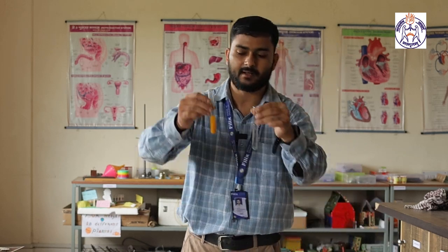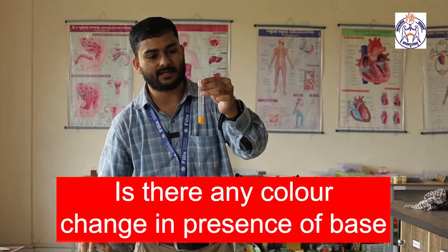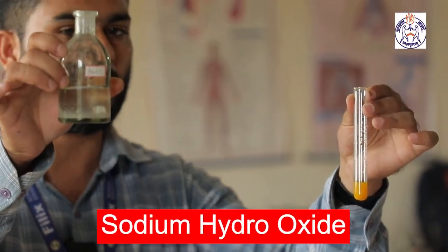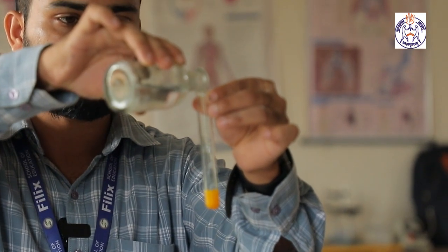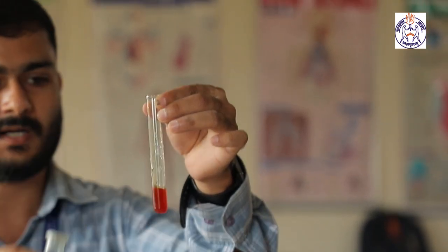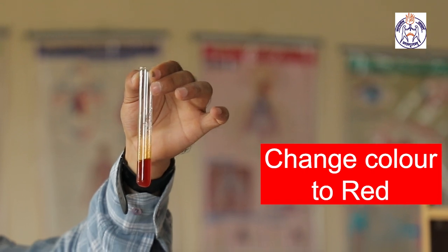But in presence of base, in the next test tube, I am taking the turmeric solution again. As we know, the turmeric solution is yellow in color. Now we are going to observe whether there is any color change in presence of base or not. So with me now it is sodium hydroxide. It is a strong base in the laboratory. Now I am adding a few drops of sodium hydroxide and see the change in color. It is deep red or reddish brown in color.